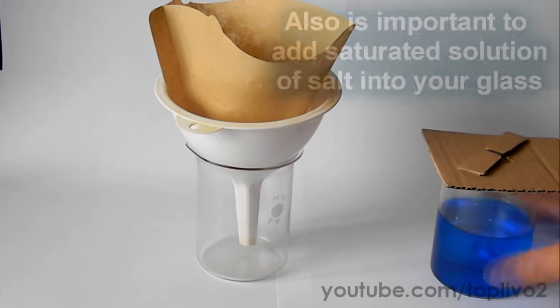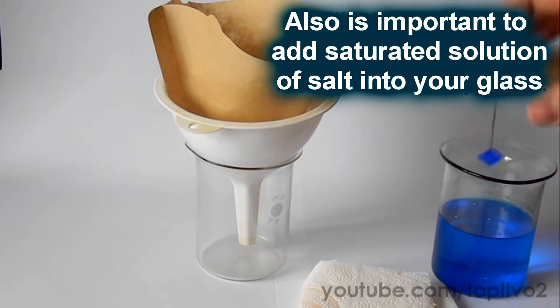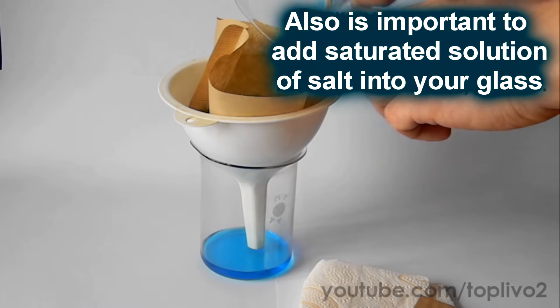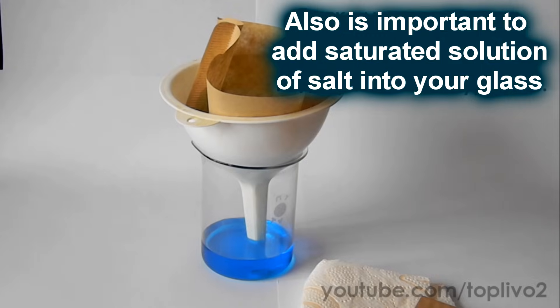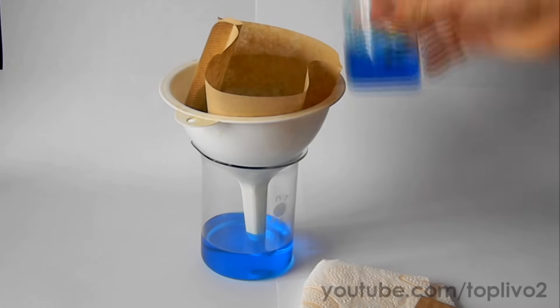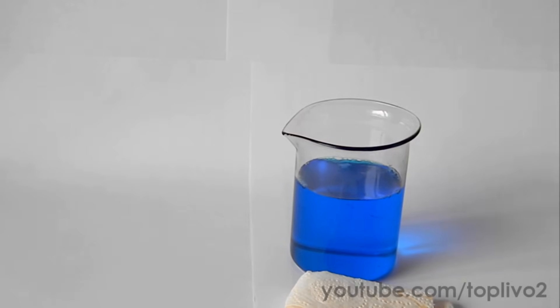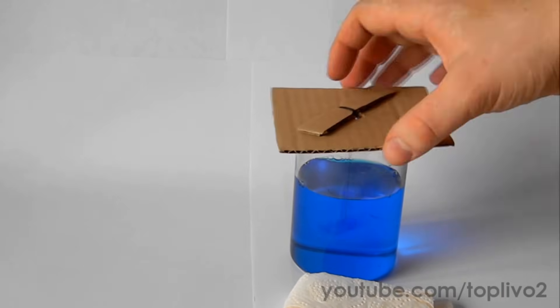If you want to get a very smooth and beautiful single crystal, you'll need to filter the solution every two weeks to maintain its clearness. If the solution is dirty, a crude crystal will grow and you'll get a polycrystal instead of a single crystal. Polycrystal is when a lot of crystals fuse together.